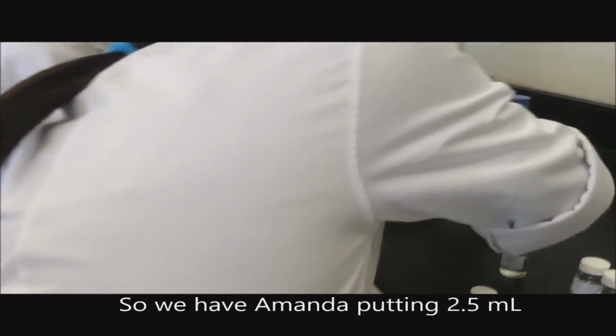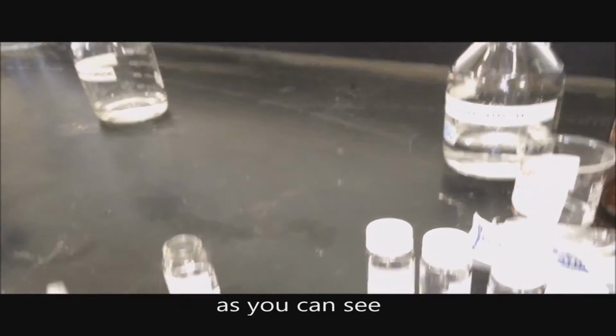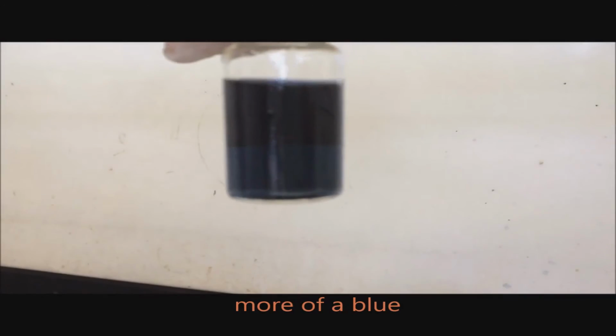So we have Amanda putting the 2.5 mils of the thing in. So now it's turned black, as you can see.